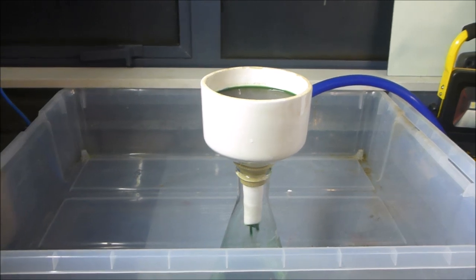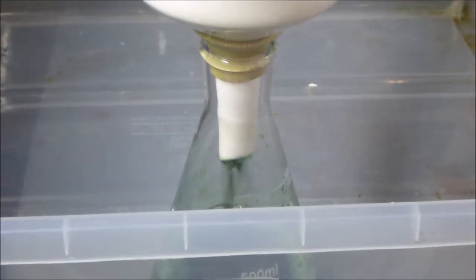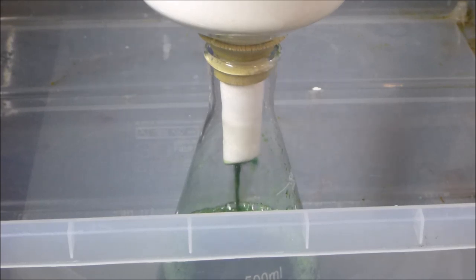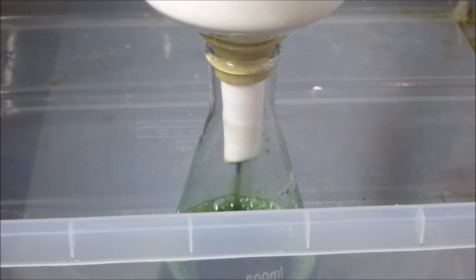Guys can see the bottom of the funnel there. See, things are going really well at the moment. Obviously with a new filter paper it would have gone pretty well anyway, so I'll go through a few more cycles and then I'll report back comparing this system to basically not doing it this way. Okay, see you guys a bit later.